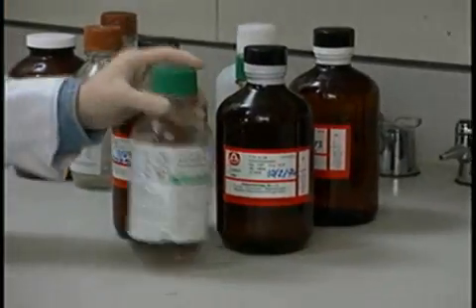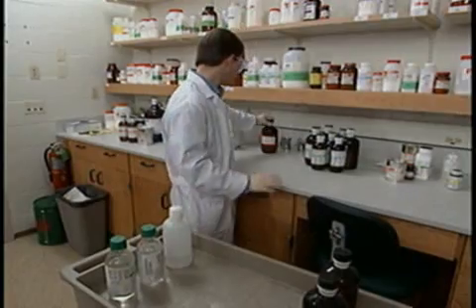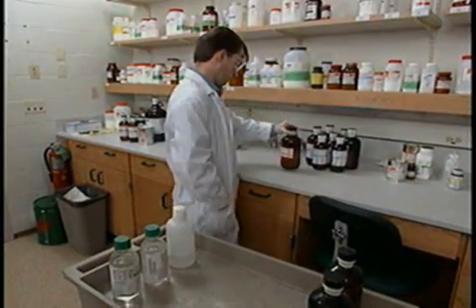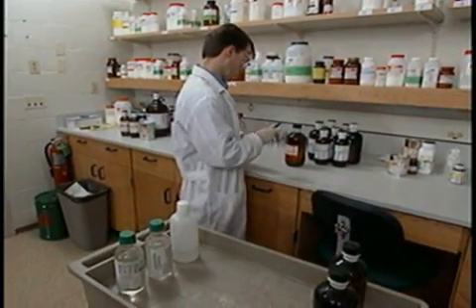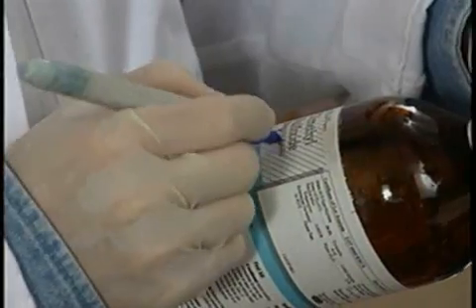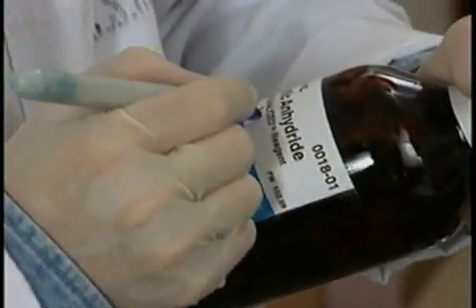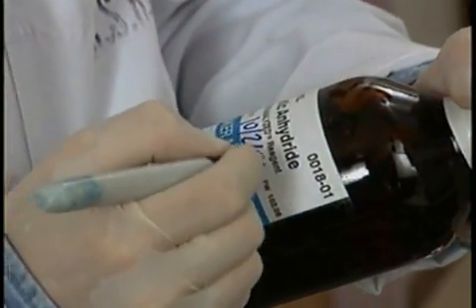They well know that some materials, like peroxide formers, can become highly dangerous if stored too long. With diethyl ether, for example, once opened, storage longer than six months is risky. You're asking for trouble if isopropyl ether is not discarded within three months after being opened. Mario marks containers of time-sensitive materials with the date received, and he'll mark them again when opened.